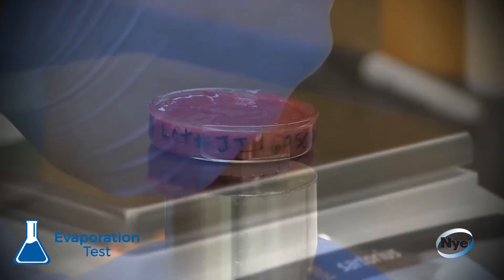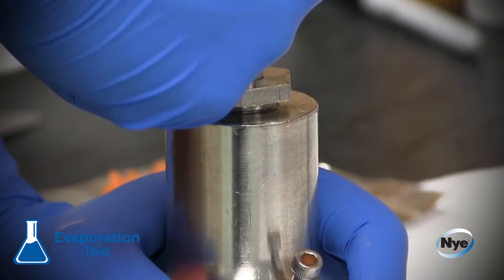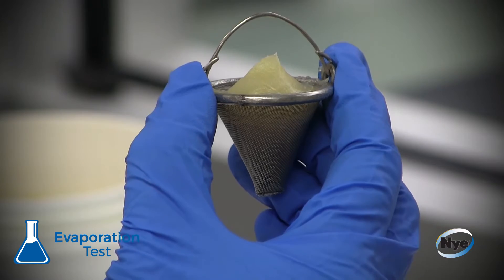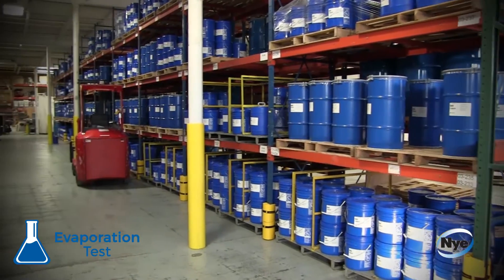This test is one of Nye's four required tests performed on all lubricants by the quality release team prior to shipping to the customer.